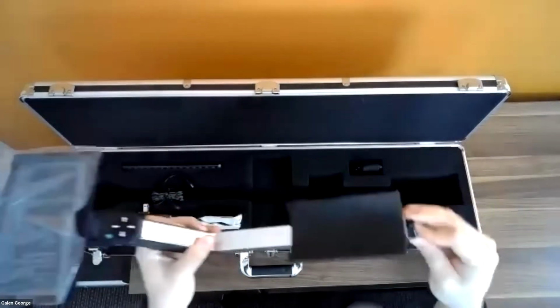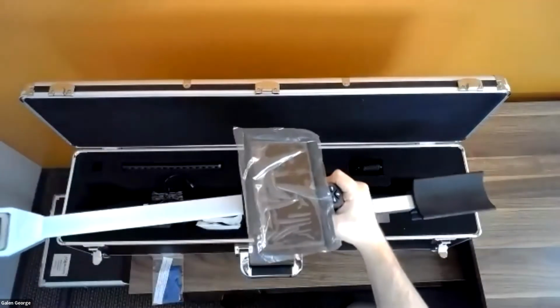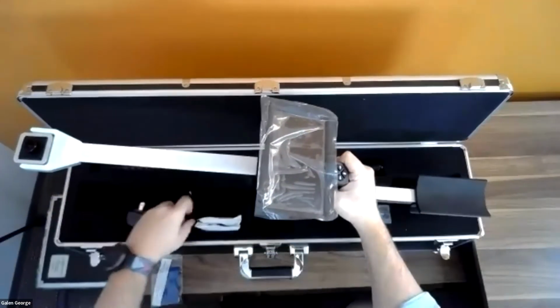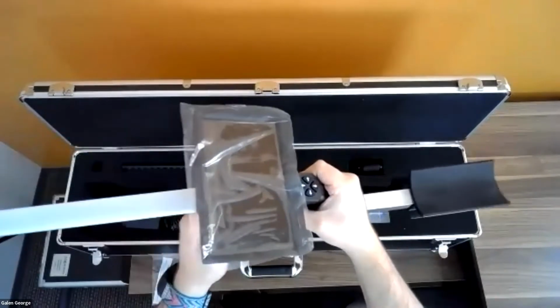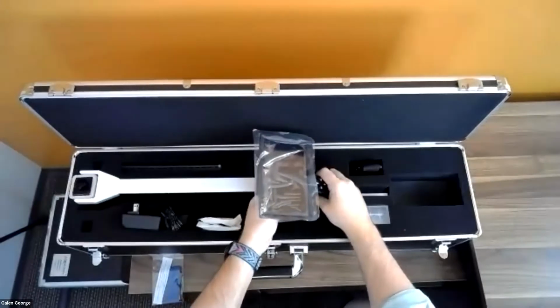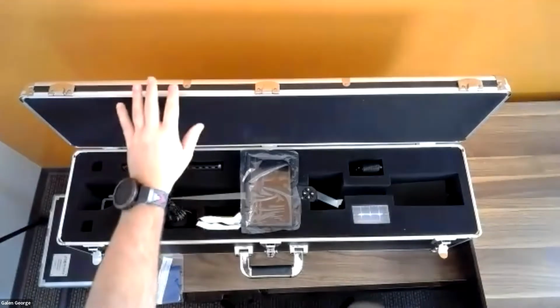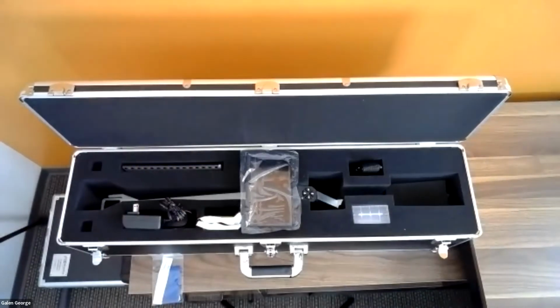So that is the instrument hardware. It's a very simple, elegant instrument, very easy to use, very lightweight, portable out in the field. And so what we want to do now is dive into what it looks like when I take a measurement and all the actual software options within this device.